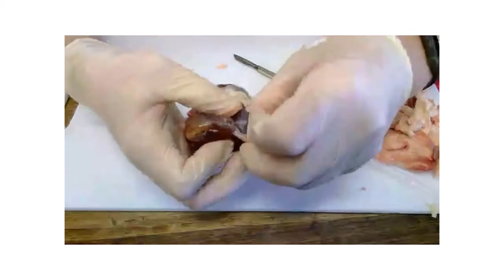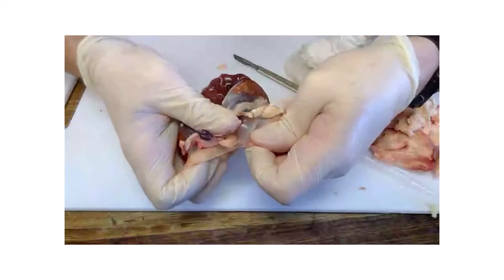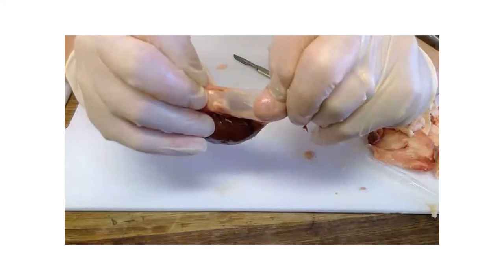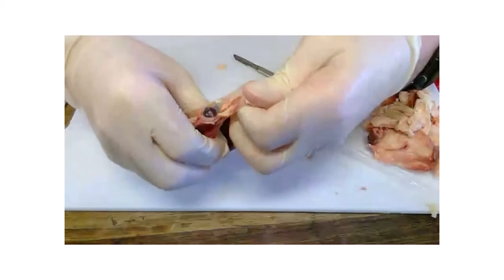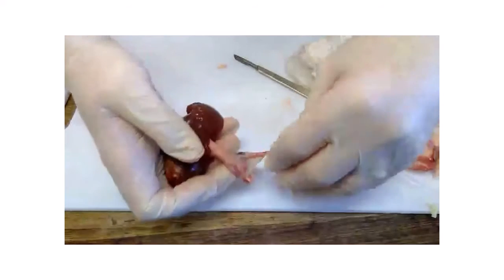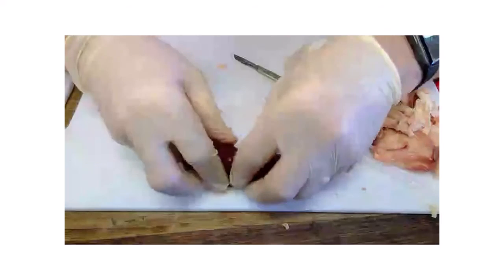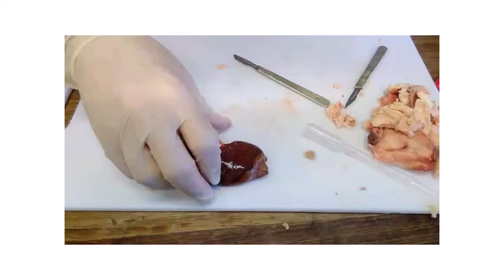And there's the capsule. Most organs have a sort of fibrous capsule over them that protects the organ. Your liver's got one, your kidneys have got them, your heart's got one, your lungs have a pleural membrane, and it protects the main soft tissue of the kidney, because you see that's quite soft and squidgy. I can only describe the smell to you. It's quite unpleasant, actually. You're probably quite glad you're not here.